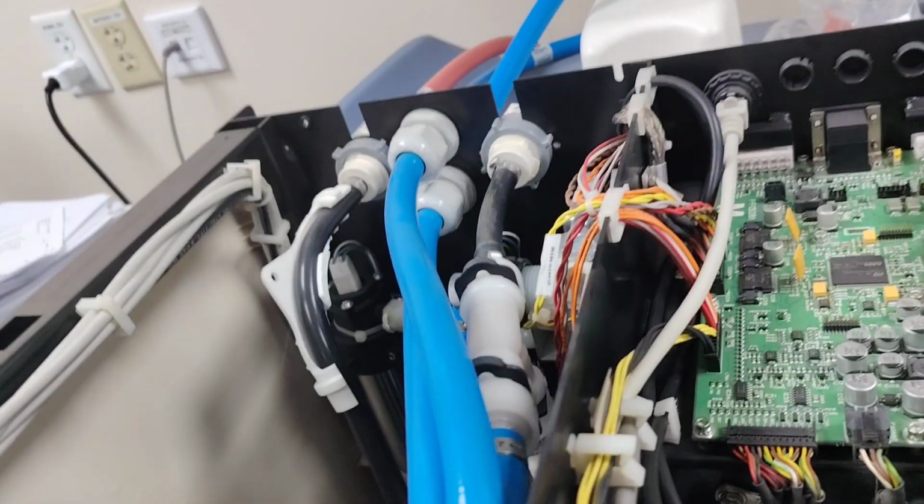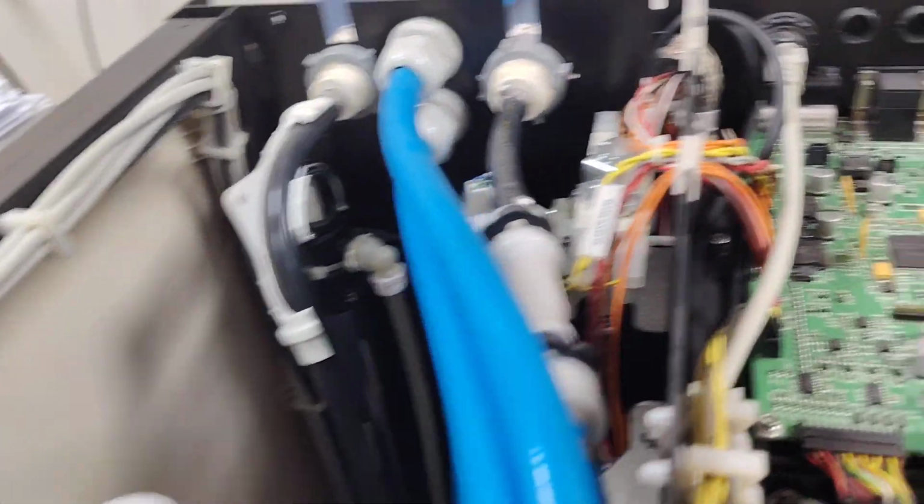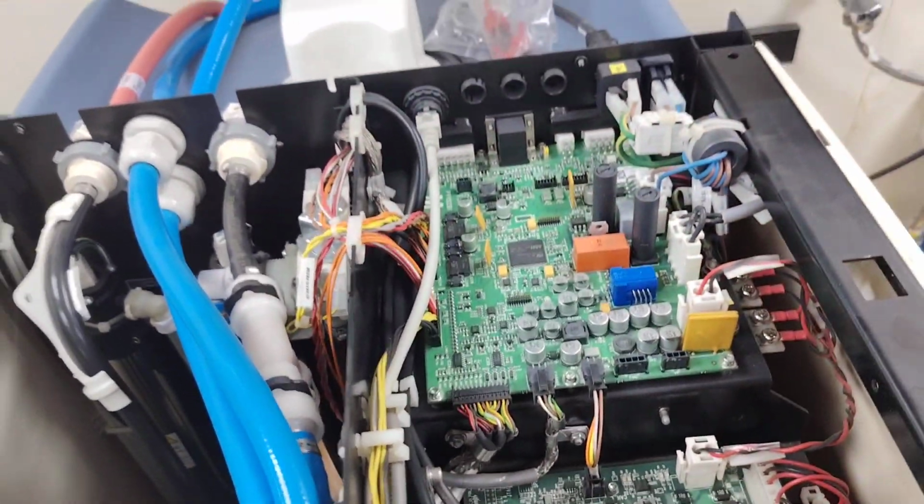So now this is the UV light. You have three UV lights. You have two here, and the other side. We'll replace this one first, the short one. It's always like this, also in my own hospital. We have more.